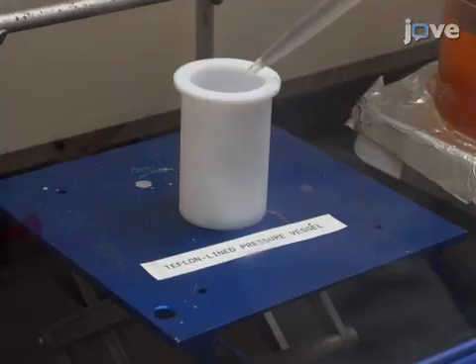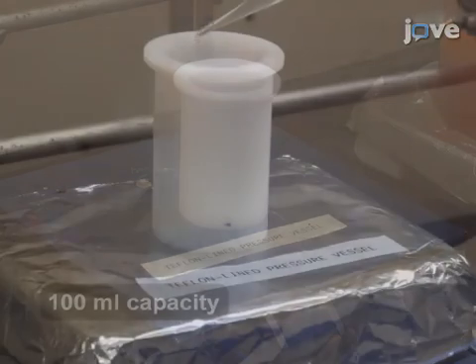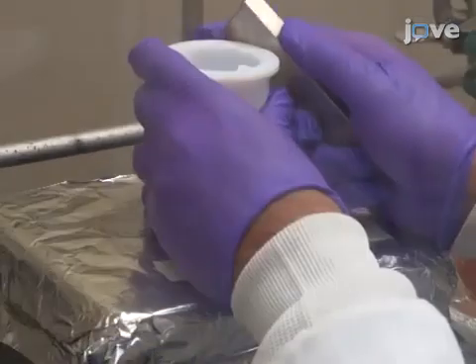Add 48 milliliters of 15 molar phosphoric acid into a Teflon-lined pressure vessel, followed by 8.25 milliliters of water. Then, add the zirconyl chloride solution dropwise to the phosphoric acid solution under vigorous stirring.